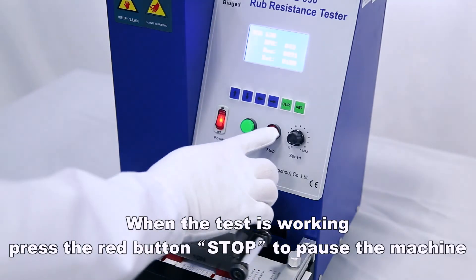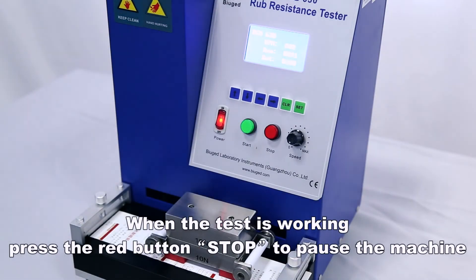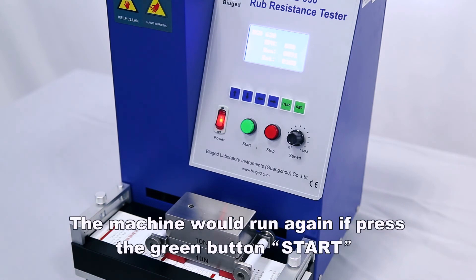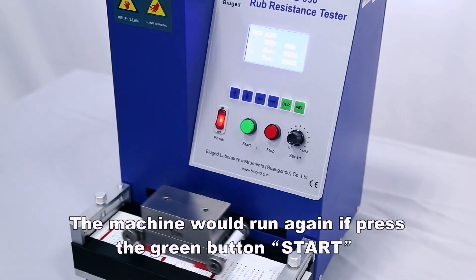When the test is working, press the red button STOP to pause the machine. The machine would run again if you press the green button START.